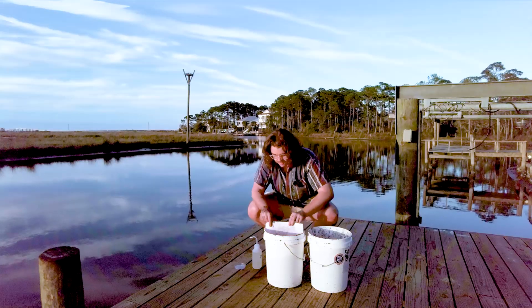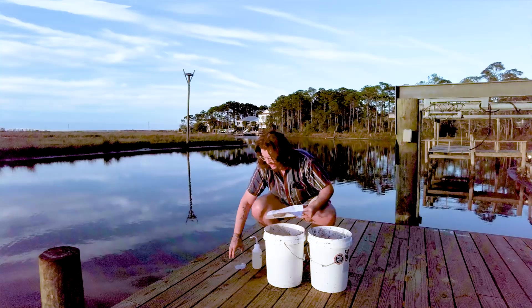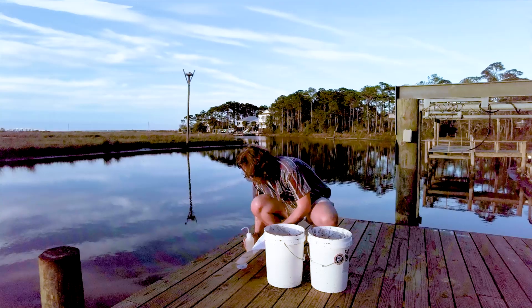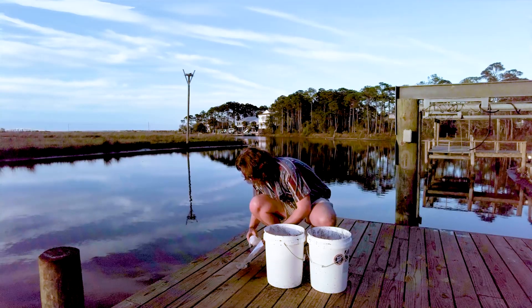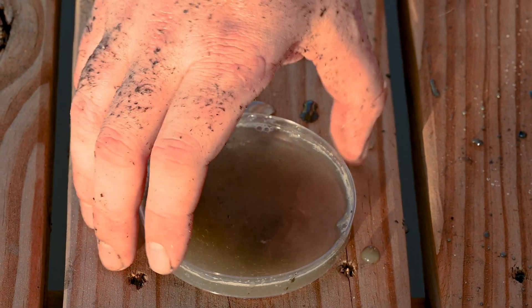Take my paper up, fold it slightly and angle it into a petri dish, and rinse off everything that I can into this petri dish. Hopefully the little mud dragons have stuck to the bubbles and they'll be in here.